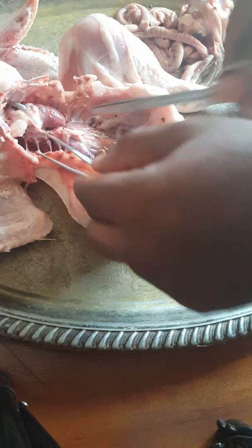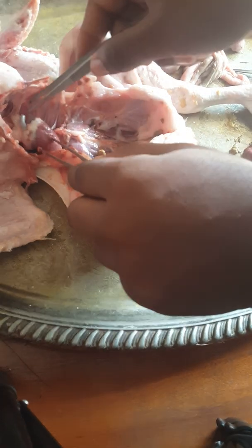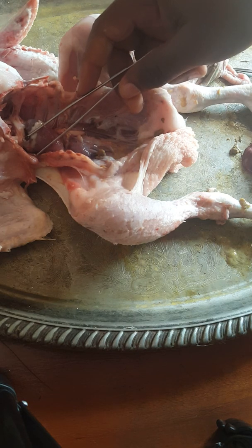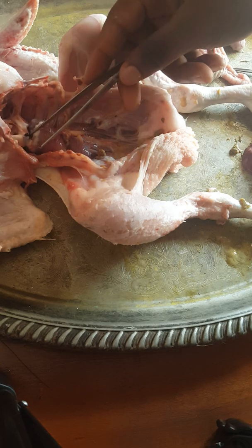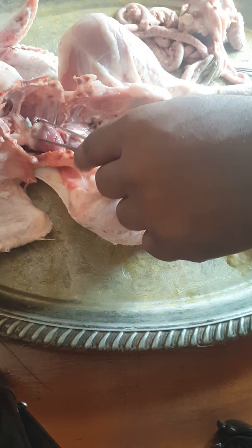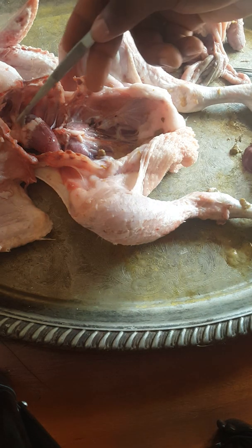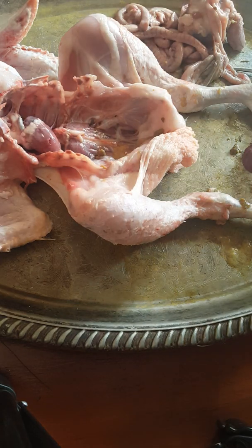So this major one here was this major artery here, which is bleeding. We realize that it is much more dark. It is a pulmonary artery, and the pulmonary artery was containing the deoxygenated blood. That's why it is dark as such. And you see that the wall of the pulmonary artery is thick, so it's very tough because the pressure which comes from the heart is very high. So this one is very dark, so we realize that it was a pulmonary artery, and it is bleeding because we just cut the lungs.